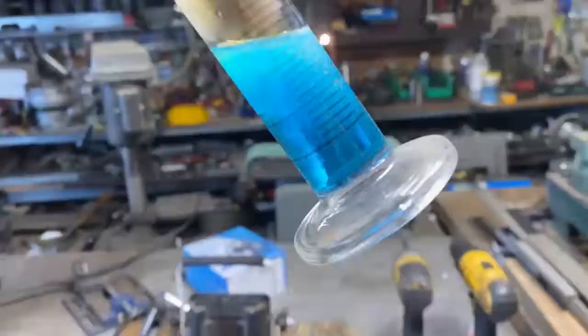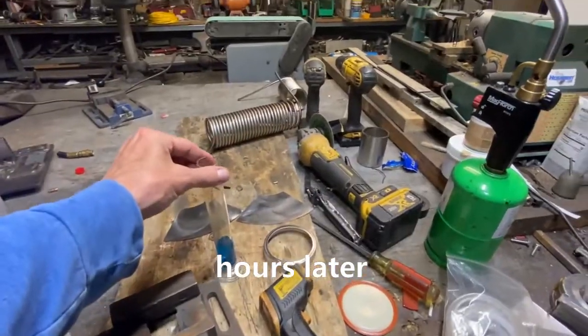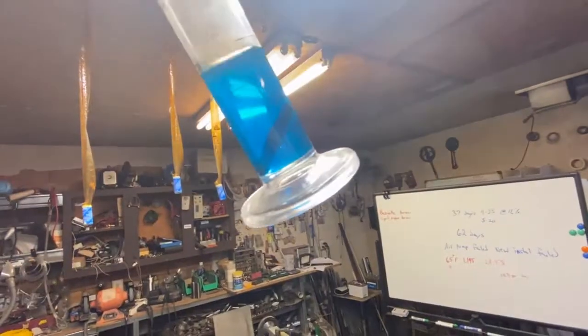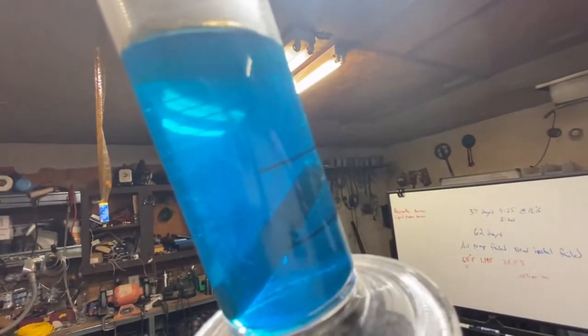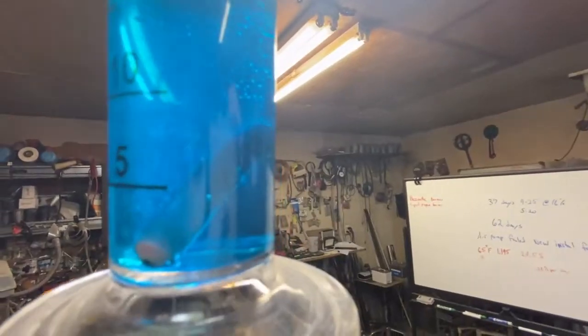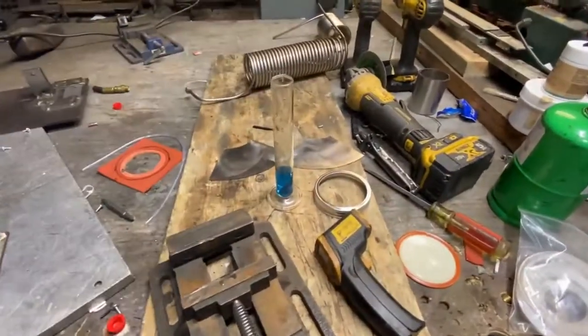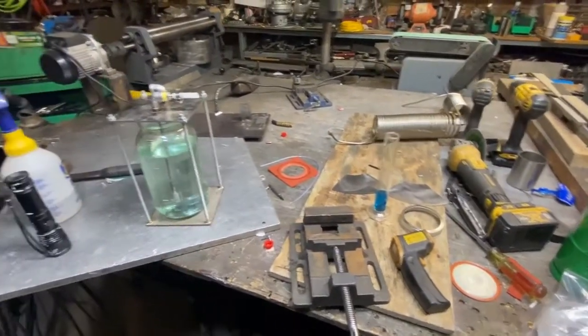Well, that's how strong the acid is now. So, you can tell by the deep blue color of this that it is doing some serious dissolving. It's still going at it. It's been several hours. It's dark out now. So, so far, so good, fellas.